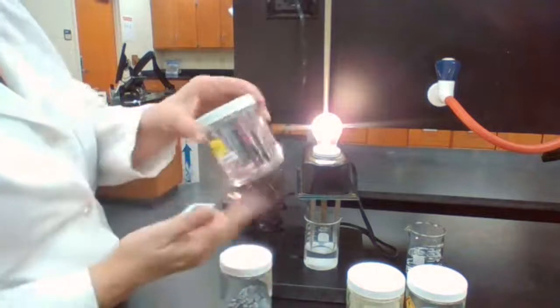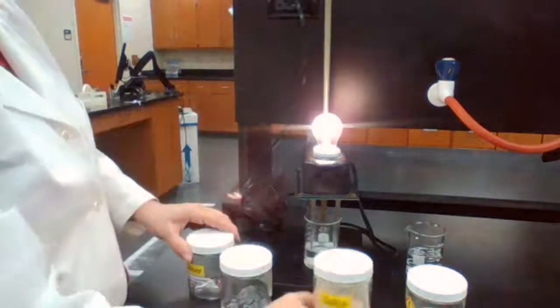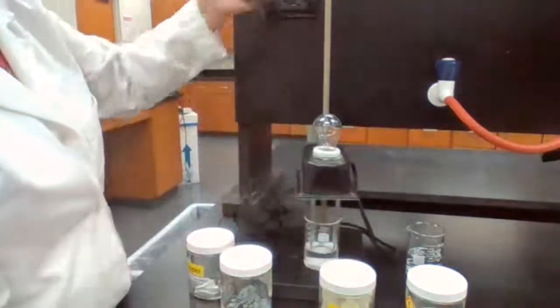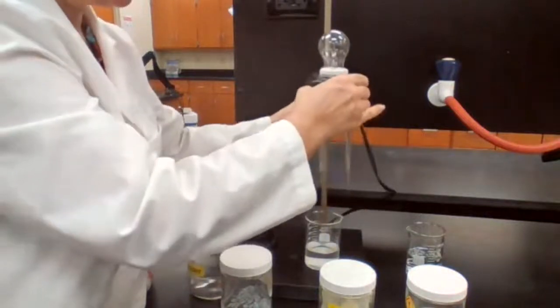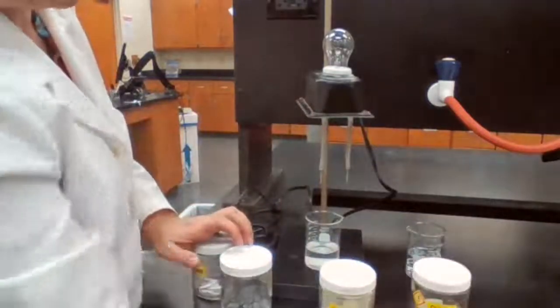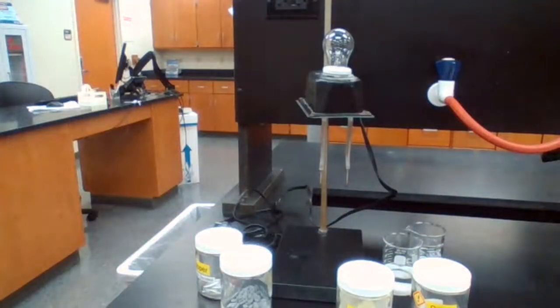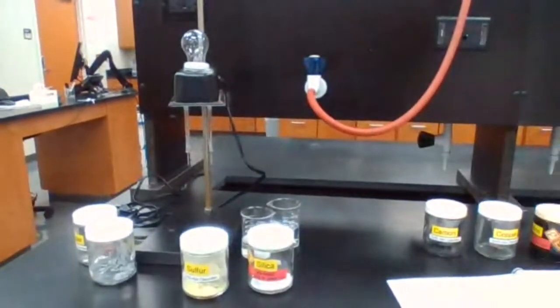It's not easy to perform the experiment with these pieces of metal. Definitely anything that is a non-metal is not going to conduct electricity. So for that part, you can answer the question based on the knowledge of how the conductimeter is working. If your element is a non-metal, like silicon and sulfur, it is not going to conduct electricity. But if they are metals, they will conduct electricity. So you can answer that part of the question yourself.